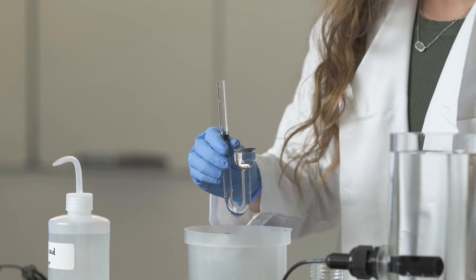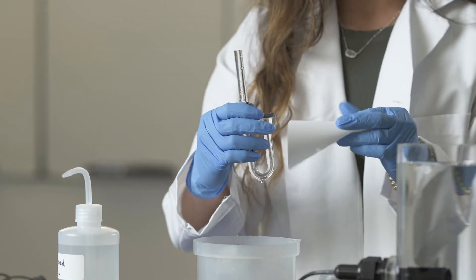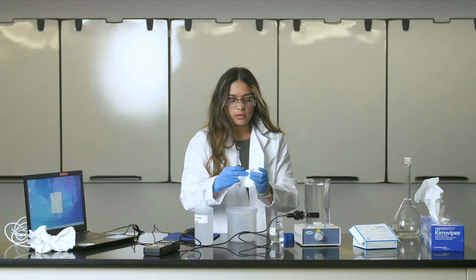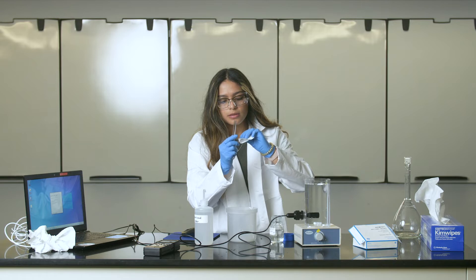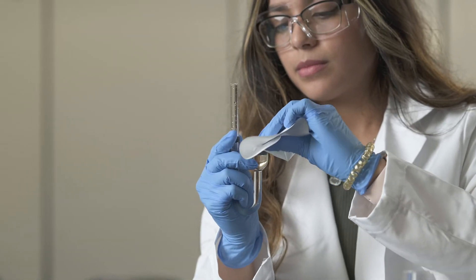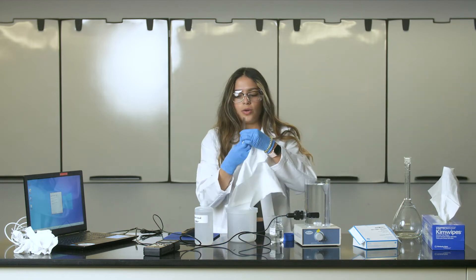We need to remove any excess solution on the top of the capillaries with this filter paper. Just be careful not to remove any of the solution from inside. Then dry the outside of the diffusion cell with another kim wipe.